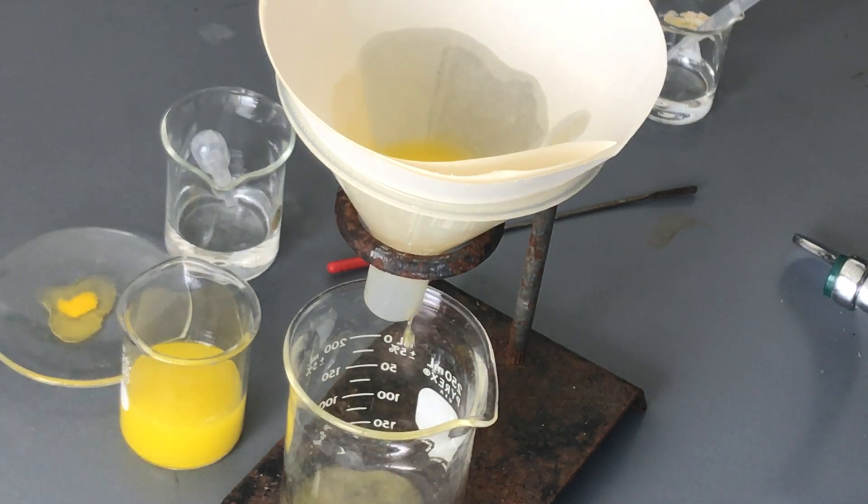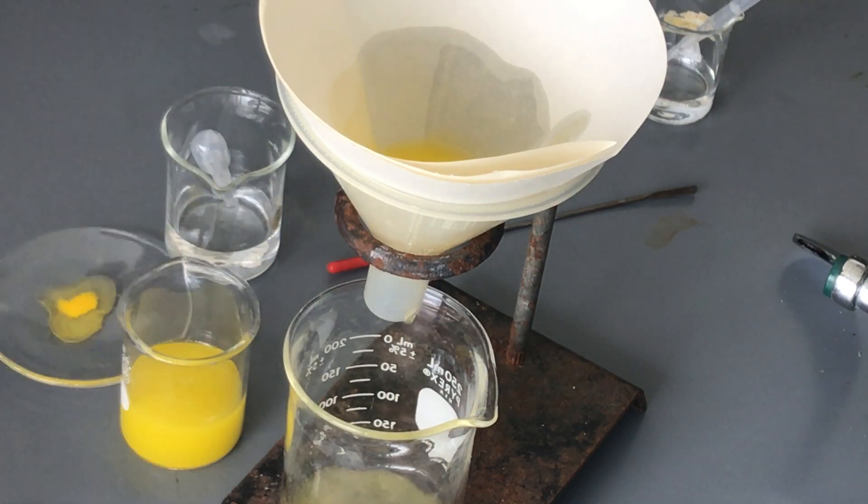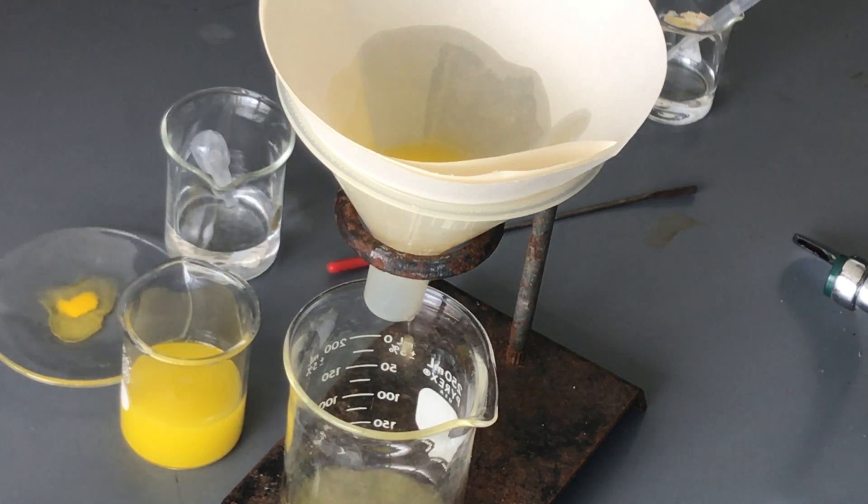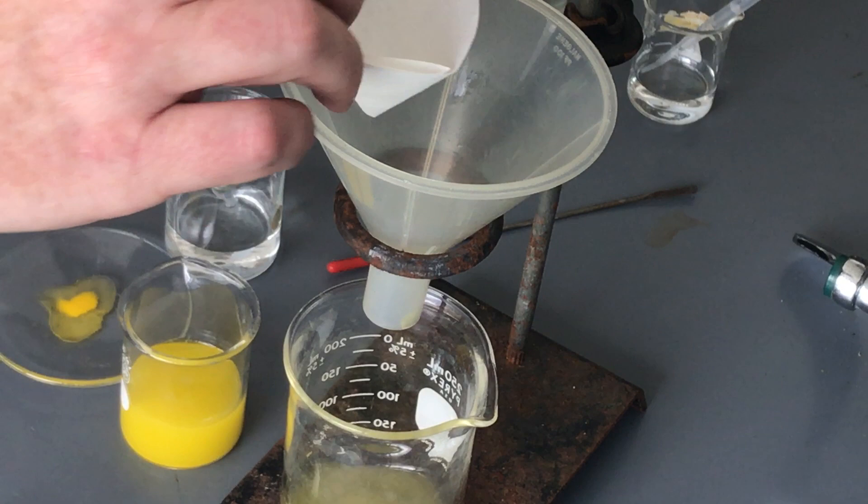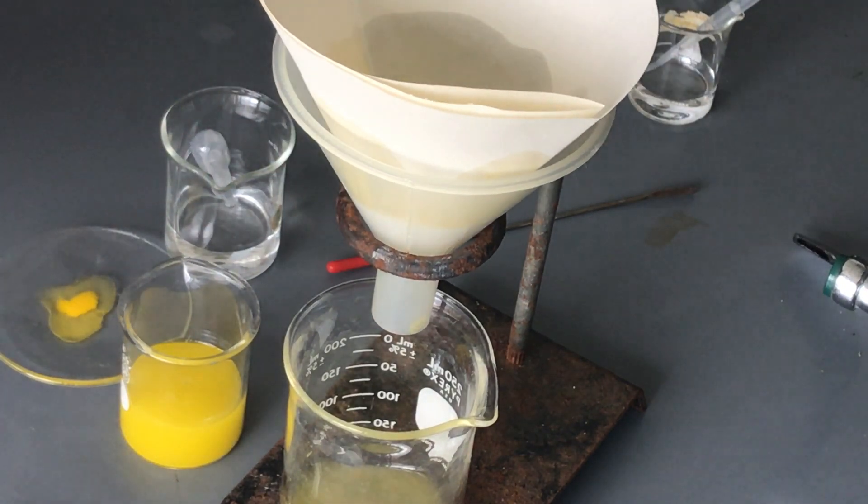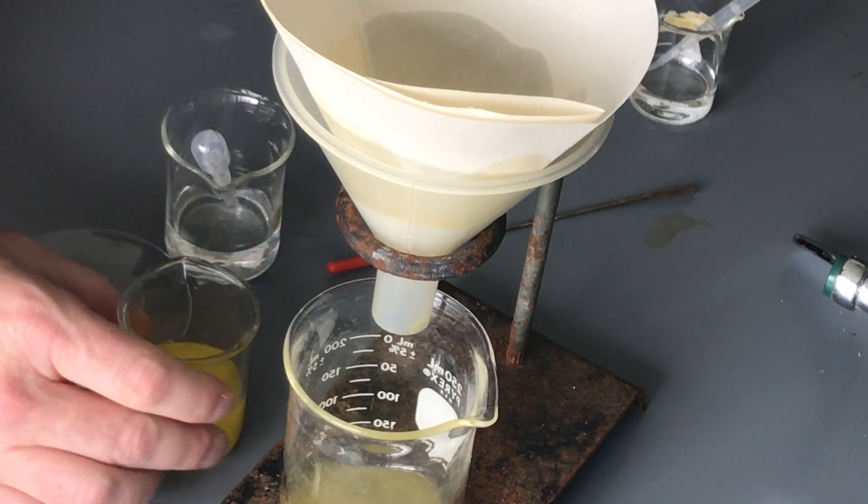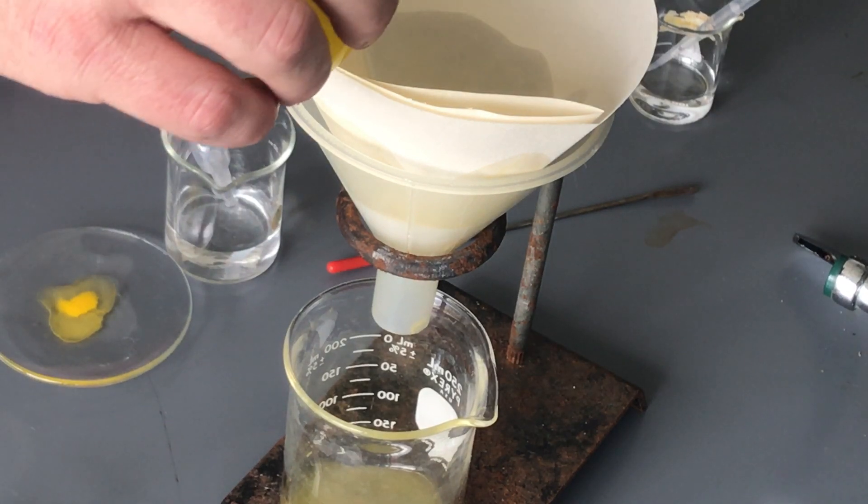And so I'm actually gonna put another smaller one underneath it quick just to see if we can catch a little of this extra material and prevent it from going. But eventually it will all start to leak out and we will also see some of the solid material at the end.